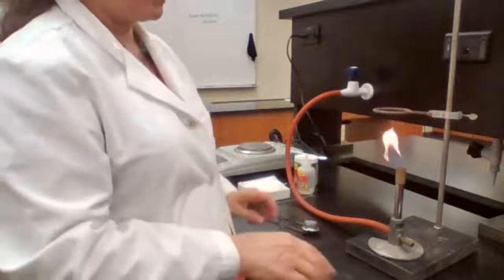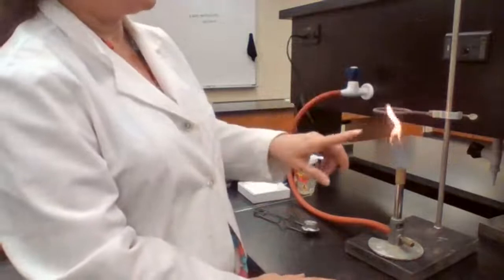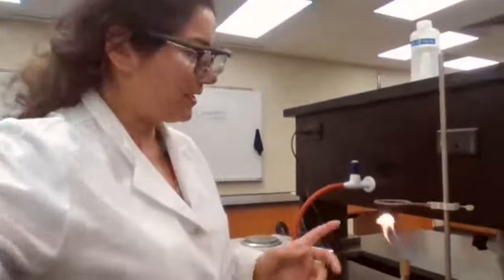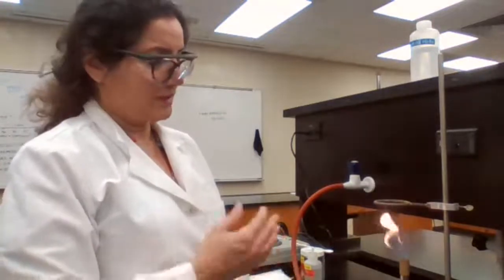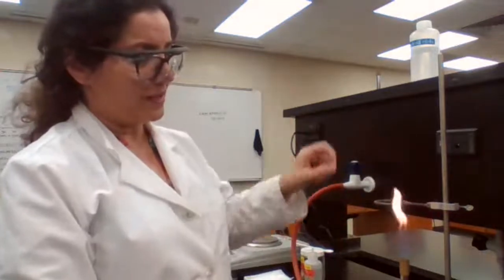When the Bunsen burner turns on, what type of flame we like to have is the blue color, 2 or 3 cone. We don't want this yellow color. Yellow color means incomplete combustion. And when you have incomplete combustion, that means the air is not enough. If you have enough air, the result of the combustion reaction of the gas gives products of carbon dioxide and water. But if you don't provide enough oxygen, it's giving off carbon monoxide. The yellow color and some smoke that is coming to the edge, that's actually producing carbon monoxide.